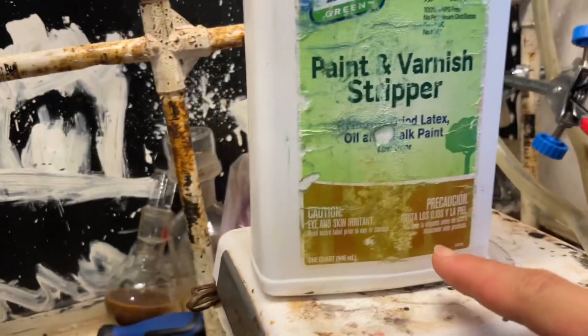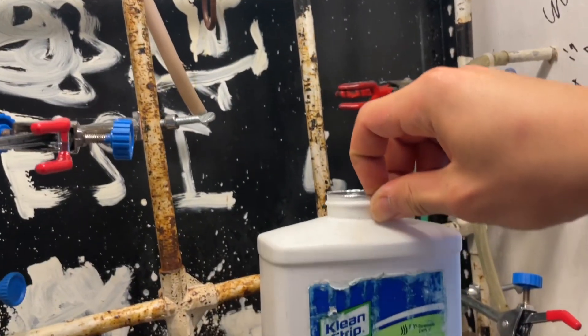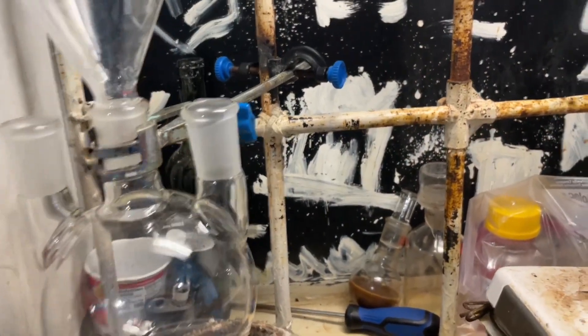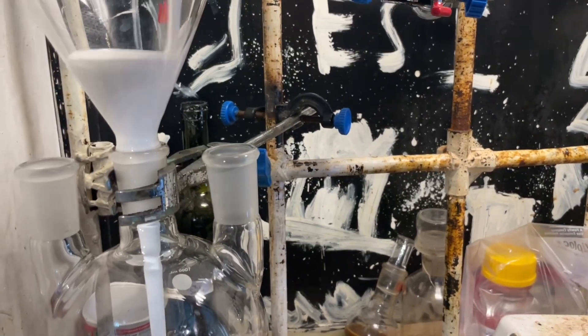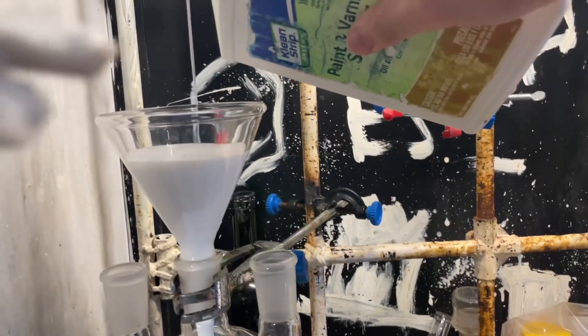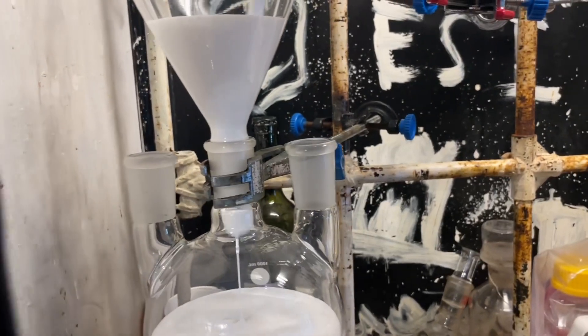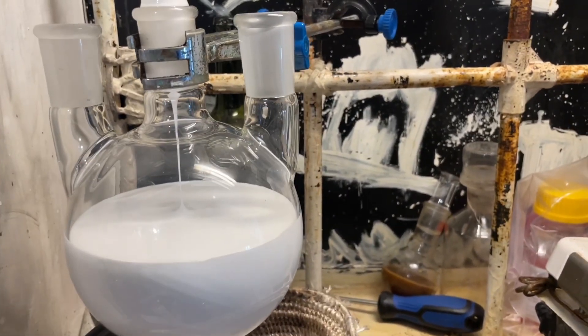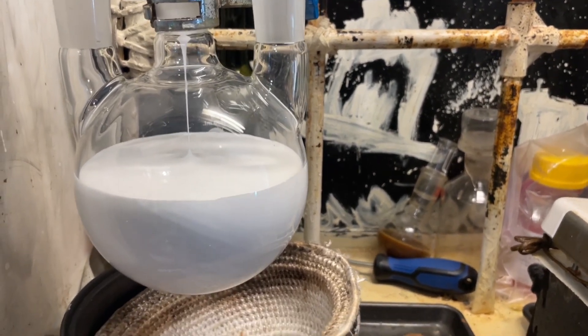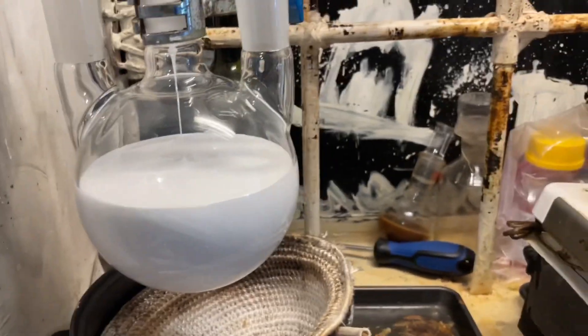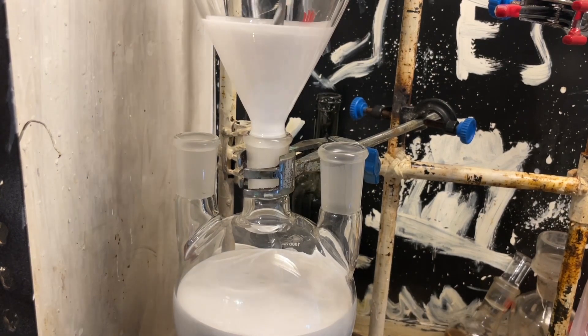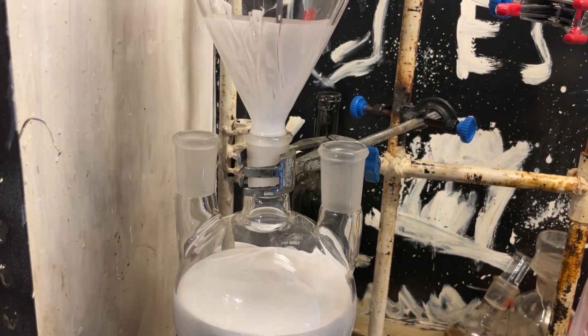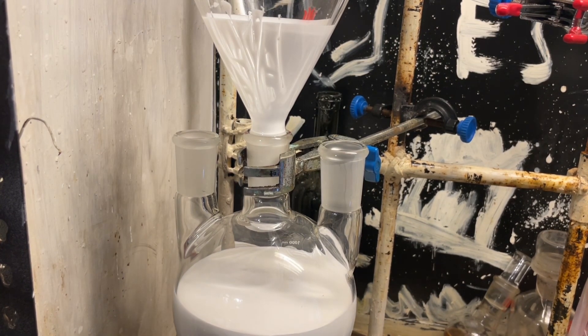But yeah, we'll be using this one-liter flask, which means that we're gonna have to separate this into two parts, which I'm fine with, because I don't want to use all of the benzyl alcohol for benzaldehyde. I don't really have a use for benzaldehyde, so I'm just gonna open this stupid foil. So I'm gonna add roughly half of this stuff into the flask, and it's a lot less goopy than usual. It's more like a glue than anything. That's neat. That should be enough, maybe a bit more, actually. The issue is that, of course, it foams when you try to distill it, so that's gonna be fun. However, I'm gonna knock down the foaming, and also, we're gonna do this under a vacuum, because last time I didn't do it under a vacuum, I ended up burning the whole thing, because of the stupid glue polymer in there, so hooray. Okay, so I'm just gonna get it all into the flask.